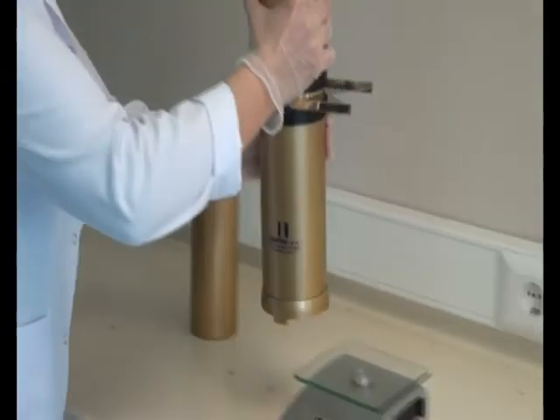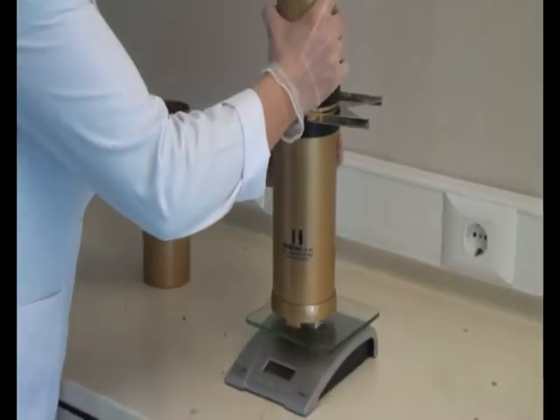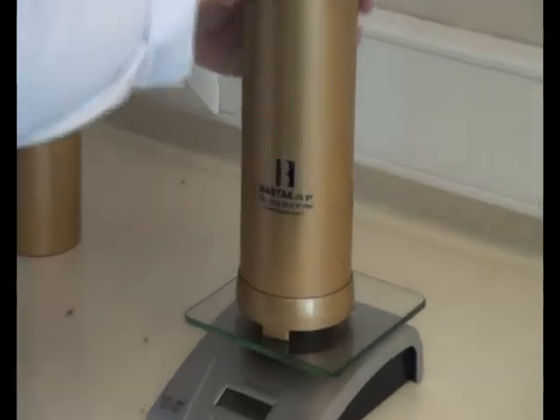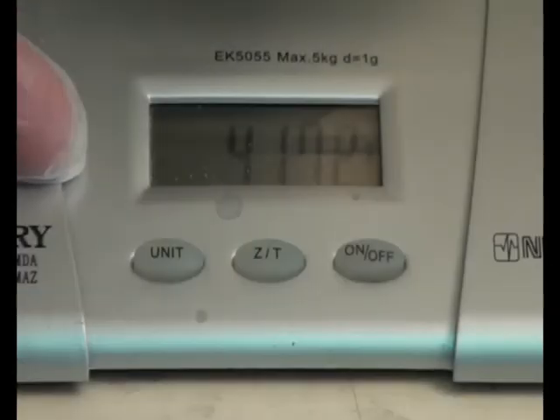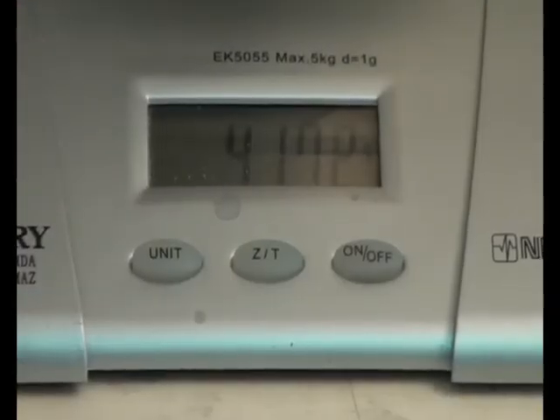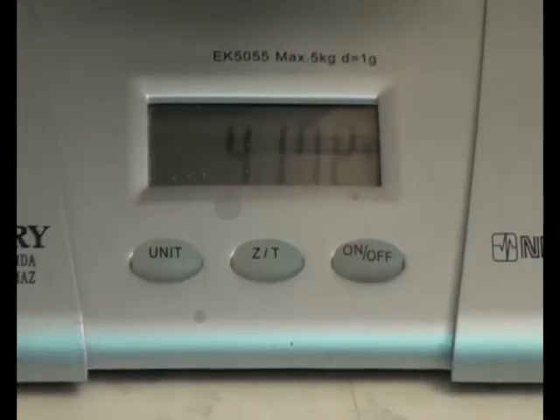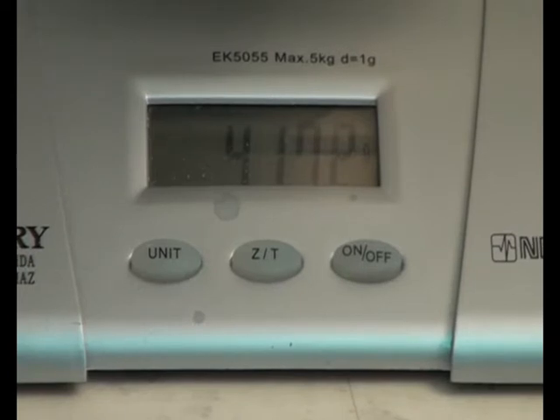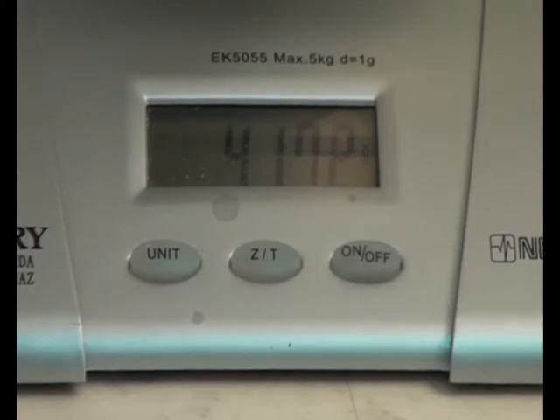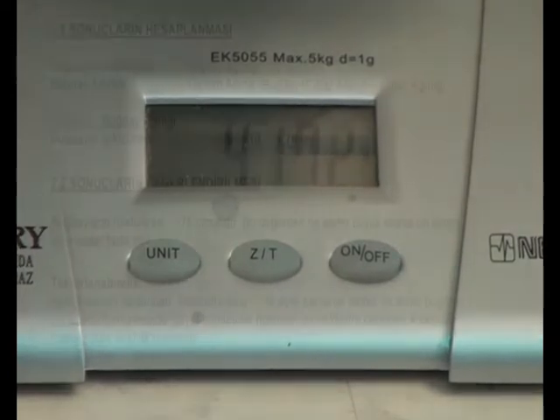The Hectaliter is weighted and noted as total weight. The weight of the Hectaliter is subtracted from the total weight. When the result is divided by 10, the value of Hectaliter is obtained.